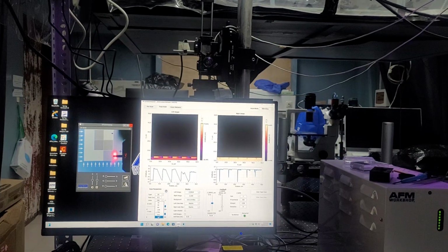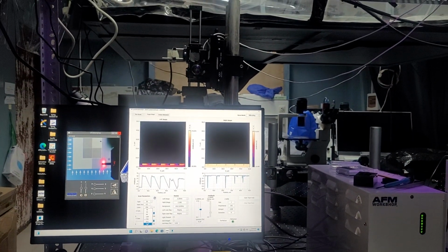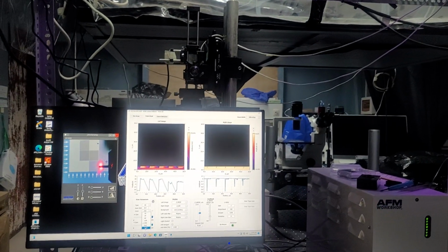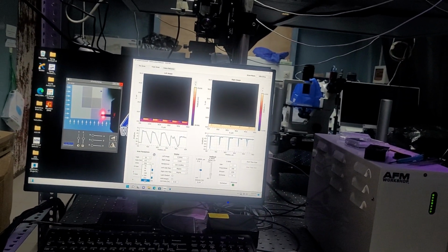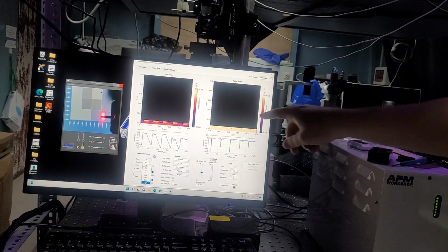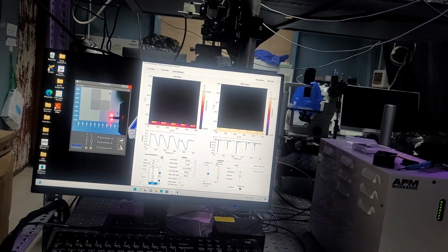So even though a typical 256 image can take 8 to 10 minutes, once you start multiplying that out, a 1024 line scan at 0.5 hertz or even slower can take a really long time. And that's a lot of potential for somebody else to come and manipulate something and put just like a single line ugly mark in your scan.